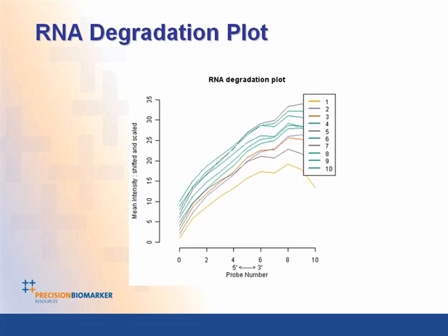So when all of the most 3' probes are averaged and ranked down to the most 5', you should get a slope that is indicative of the RNA quality. What's important to look at is the value of the slope itself, but probably more important is whether all the chips are similar in their slope. In this case, they do all look fairly similar.